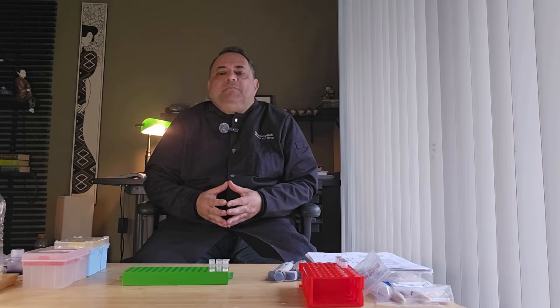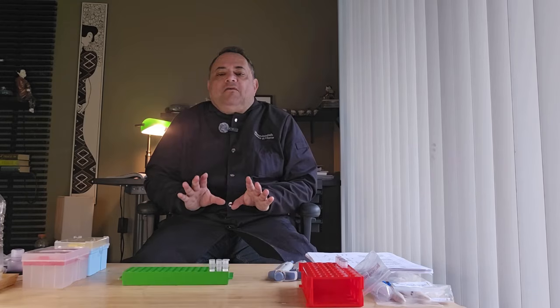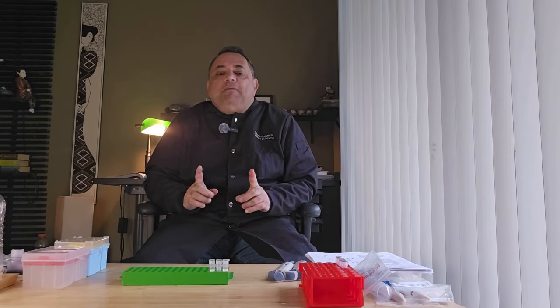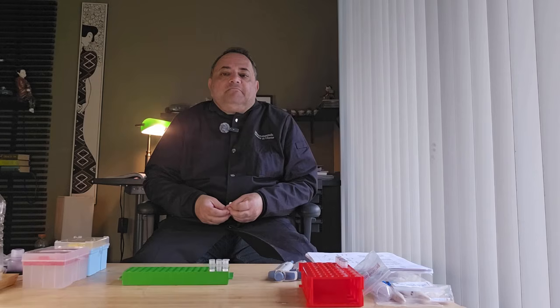Once the Cas9 protein makes a cut of the gene we want to edit, the cell begins to try and repair. We will flood the cell with a template that is similar to the missing region but has a mutation. The cell will mistake it for a true copy and use it instead.